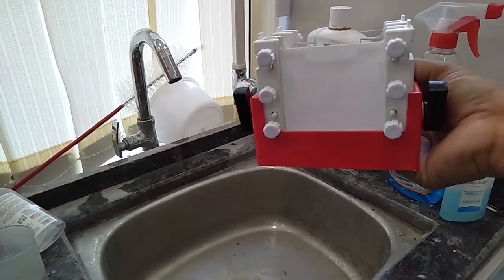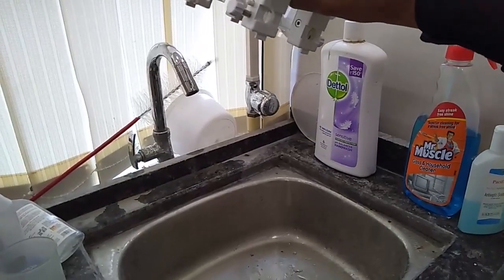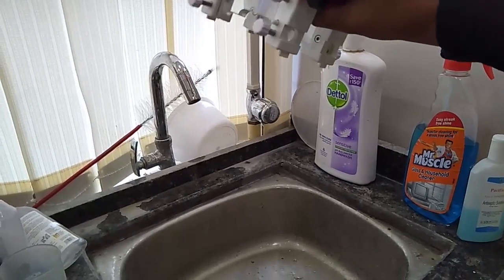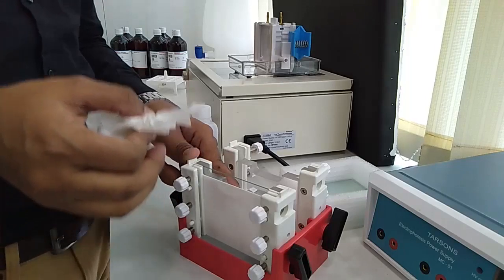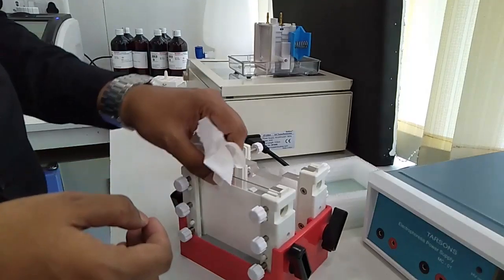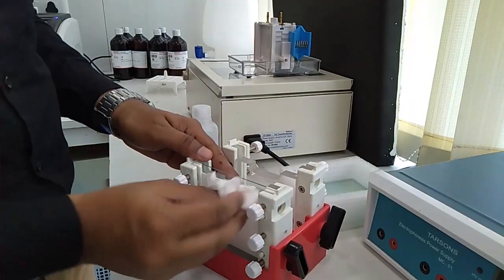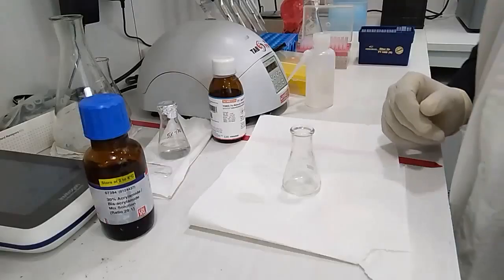Okay, I can see there are no leaks into it. Now we'll remove the water we had inserted into it. We removed all the water from it. Now we'll make it dry. Make sure that there is no water cleared by the tissue.